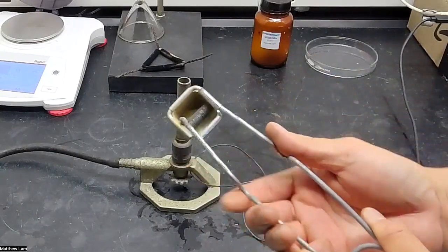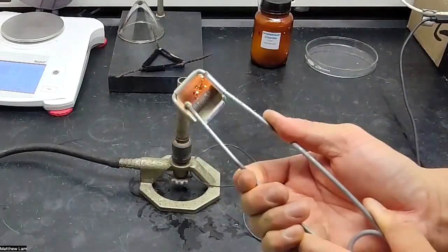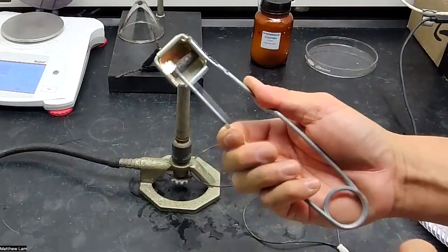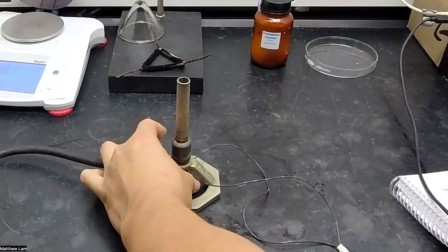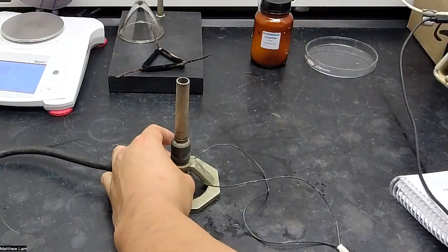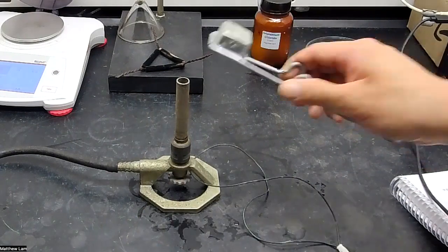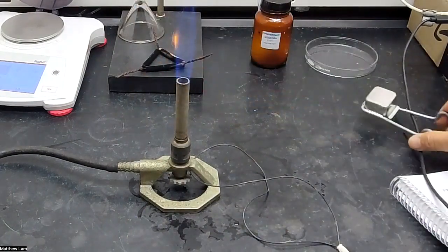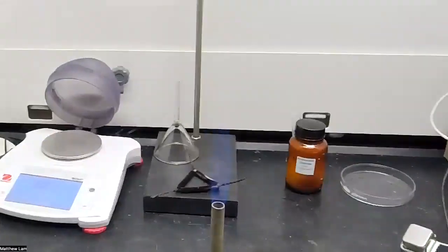And so here we have a striker. This thing has a flint attached to it and causes sparks. So if I turn this on, introduce some gas on the bottom here, and I use this flint, the Bunsen burner starts.